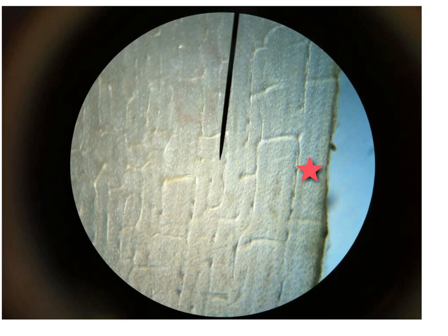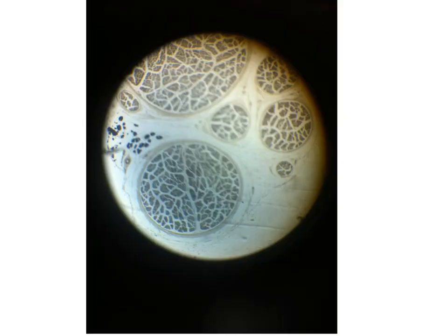Don't be mistaken by this slide, because it is a longitudinal section, so it has the same features as the transverse section of the ground compact bone. In the exam, you are not asked to mention LS or TS, just mention it is a ground compact bone. The second slide in this group characterized by the color is this section.